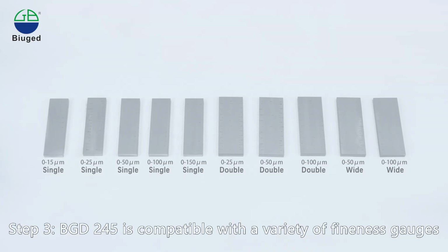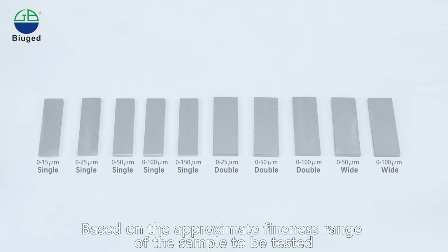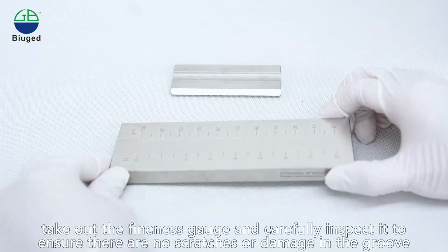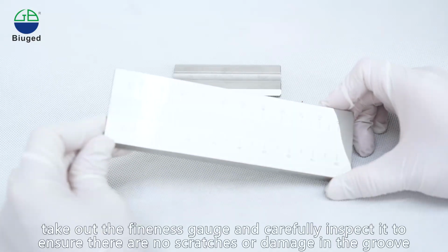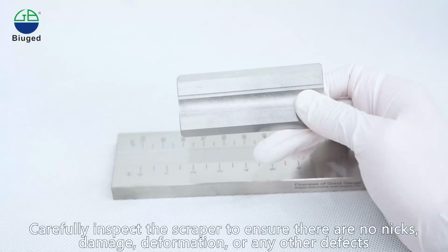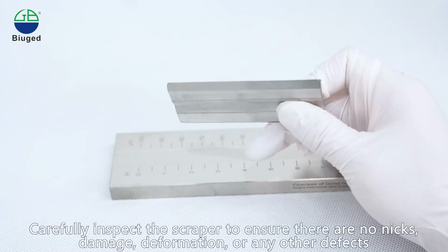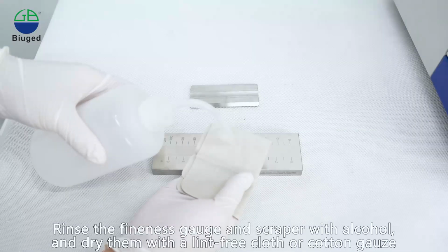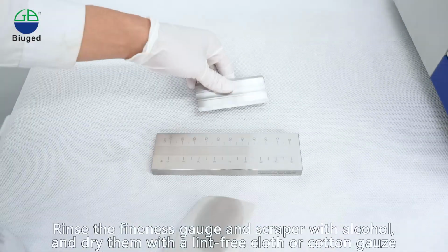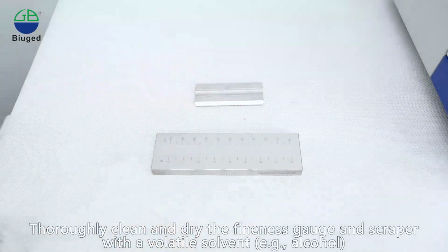Step 3. BGD 245 is compatible with a variety of fineness gauges, based on the approximate fineness range of the sample to be tested. Take out the fineness gauge and carefully inspect it to ensure there are no scratches or damage in the groove. Carefully inspect the scraper to ensure there are no nicks, damage, deformation, or any other defects. Rinse the fineness gauge and scraper with alcohol, and dry them with a lint-free cloth or cotton gauze. Thoroughly clean and dry the fineness gauge and scraper with a volatile solvent.